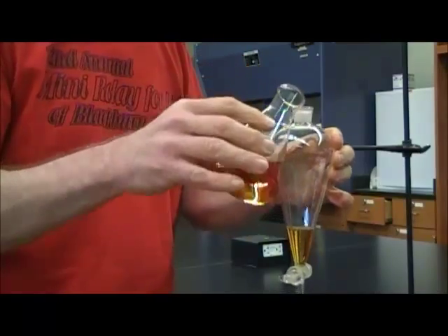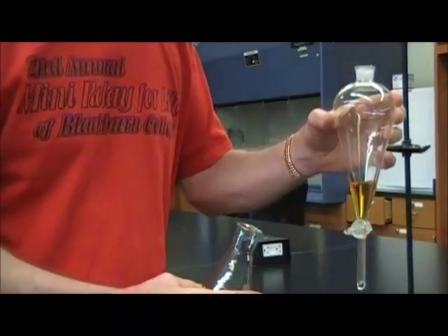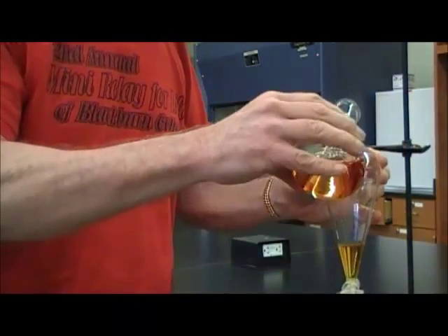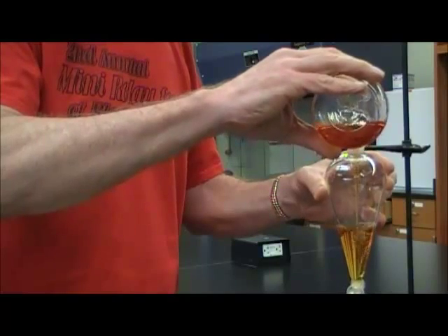So I'm going to pour it in. Obviously, before I poured it in, I wanted to make sure the stopcock is closed. Otherwise, the liquid goes out onto the table and you're embarrassed. So make sure your stopcock is closed before you put anything into the separatory funnel.